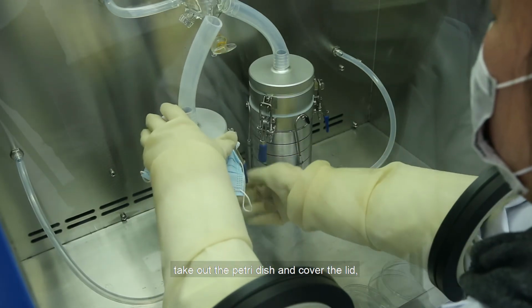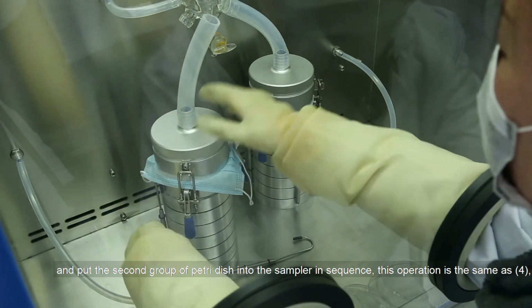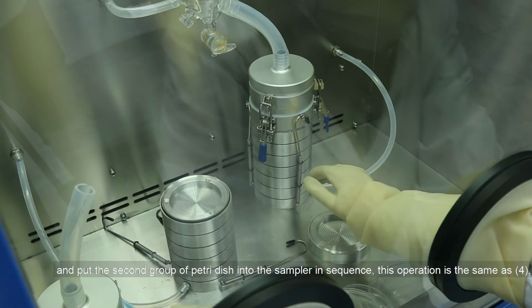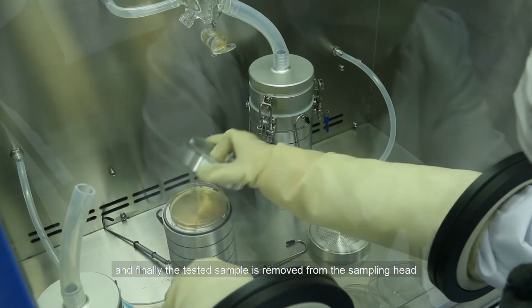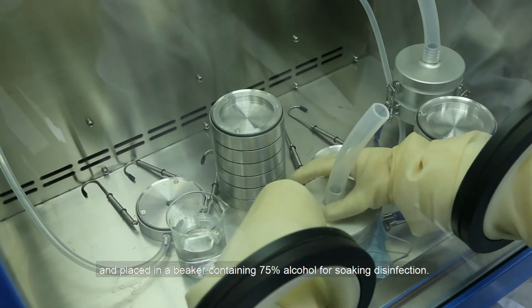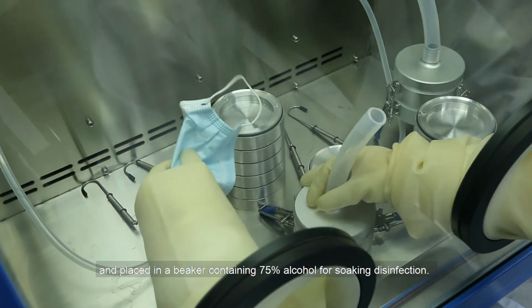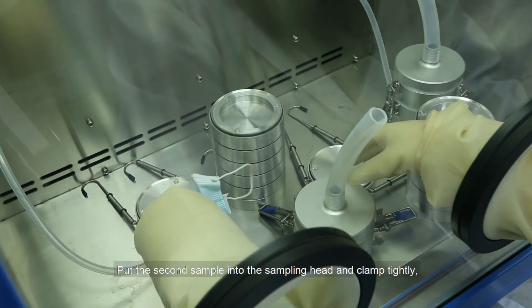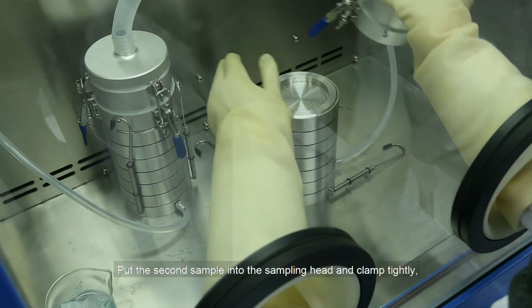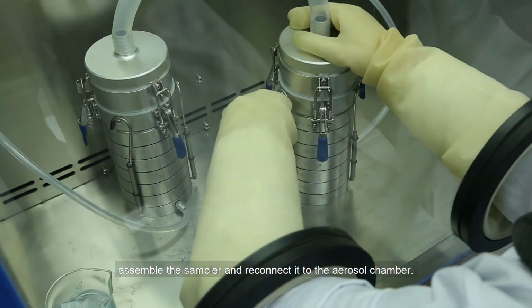Take out the petri dish and cover the lid, and put the second group of petri dishes into the sampler in sequence. This operation is the same as before. And finally, the tested sample is removed from the sampling head and placed in a beaker containing 75% alcohol for soaking disinfection. Put the second sample into the sampling head and clamp tightly. Assemble the sampler and reconnect it to the aerosol chamber.